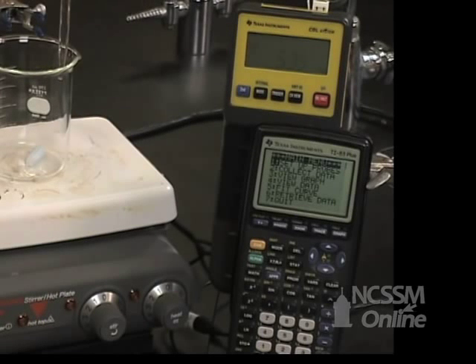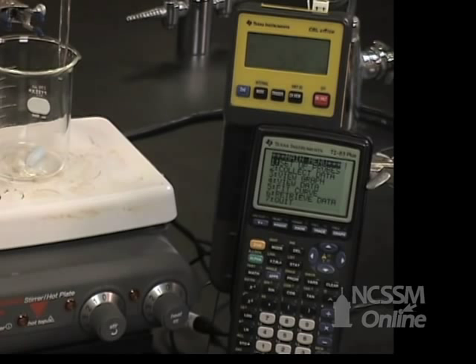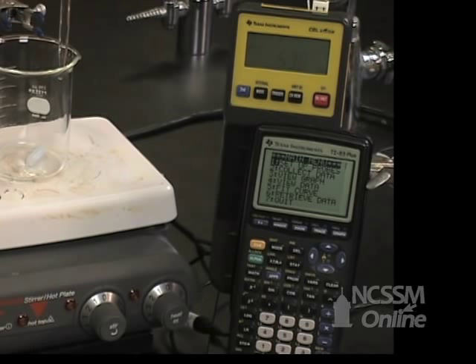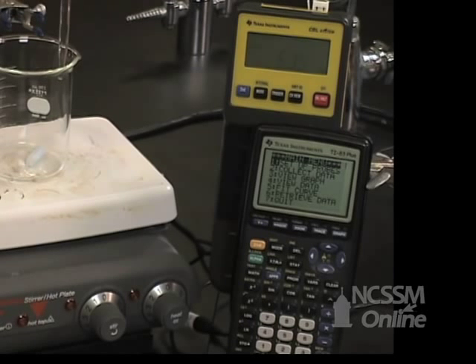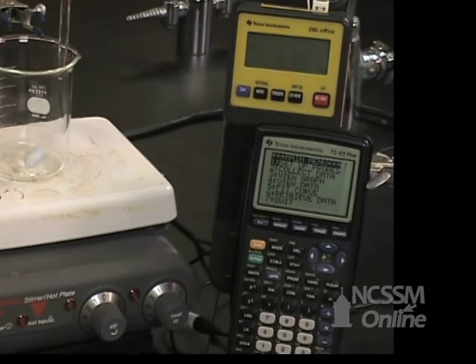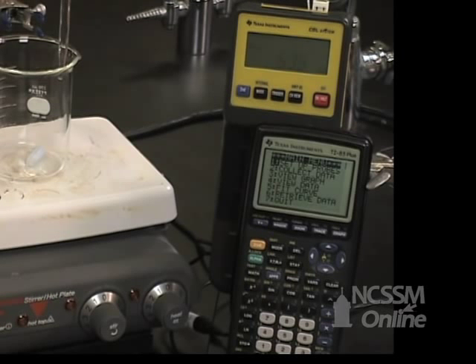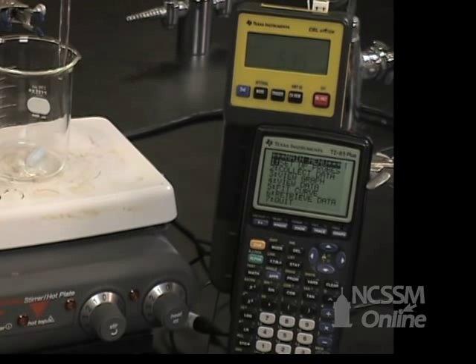We're going to titrate a sample of phosphoric acid with a solution of sodium hydroxide as an example of titrating a polyprotic acid.